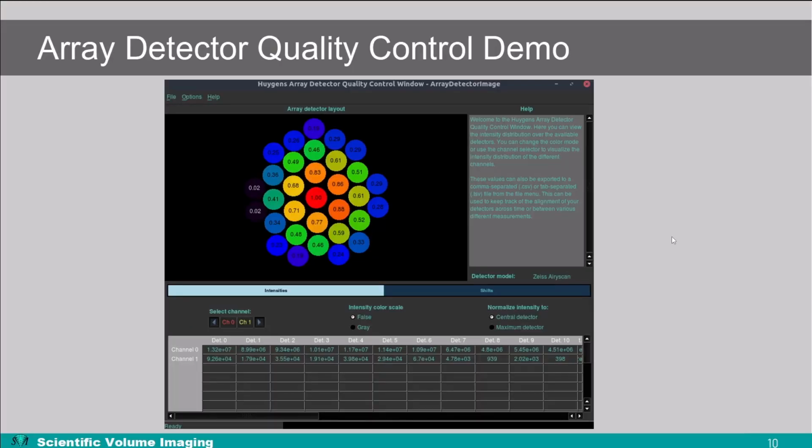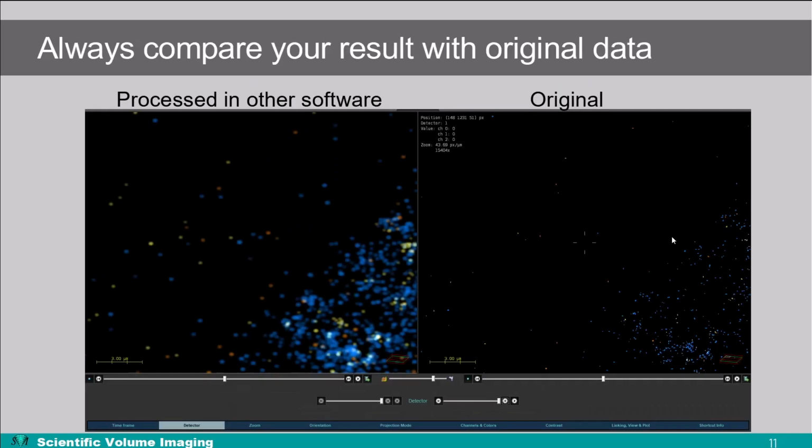So let's go back to the slides and take a look at a couple examples I wanted to show. So whether you're processing in Huygens or other software, make sure to always check your results with the original raw data. Here we can see an image of an array detector microscope that has not been processed correctly. On the right hand side we see the raw data, and by comparing it to this result we clearly see that each measured pixel was interpreted like a spherical blob after processing.